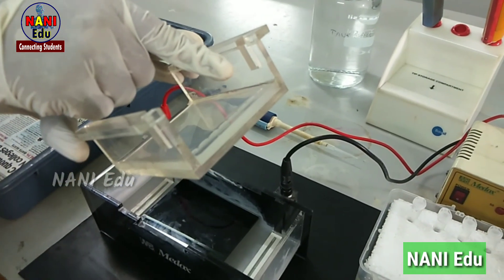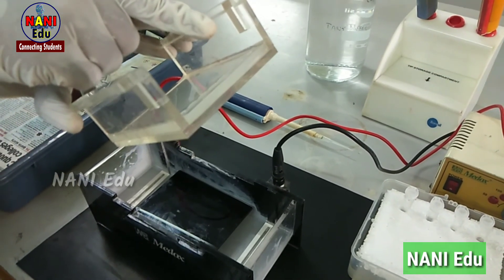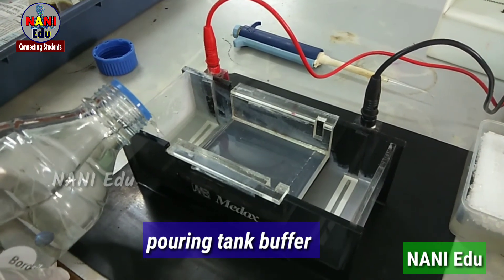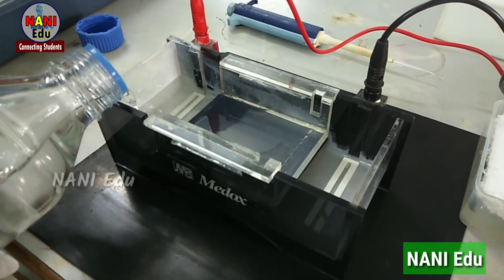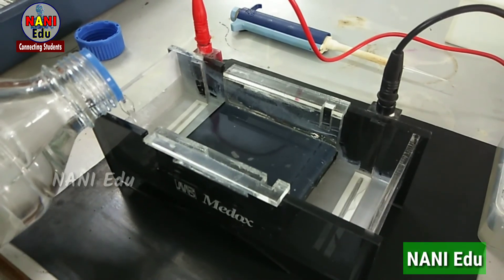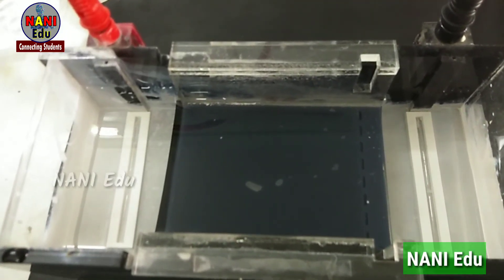It is a thin gel we need. Don't go for thick gel — if the gel is thick you can't visualize properly. Go for thin gel. The boat is there and above the boat the gel size is there. Now we keep it on the tank. We are adding the tank buffer into the boat, above the gel level. The tank buffer composition is: Tris base, boric acid, EDTA, and distilled water. You have to add the tank buffer above the gel level.